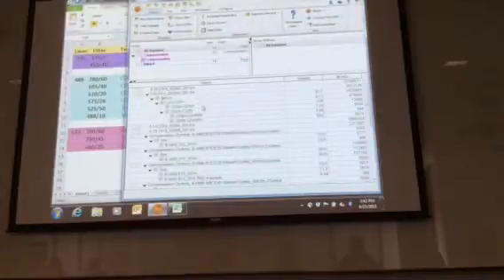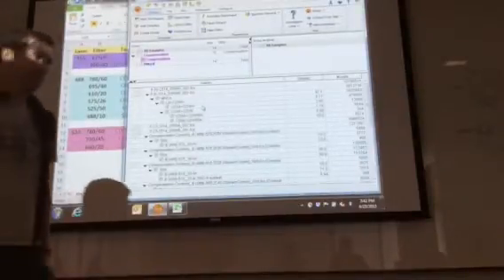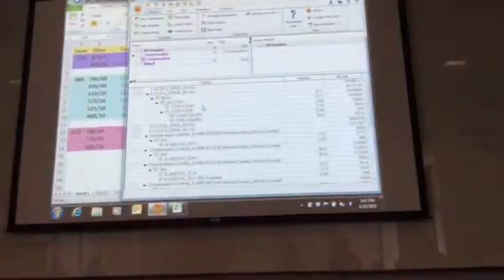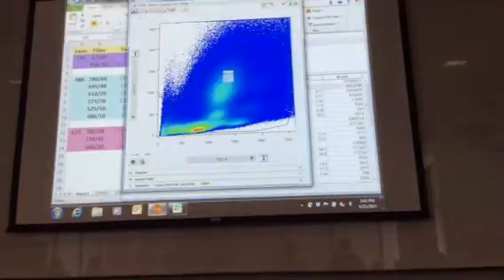And then what that will give you is a number of cells. I still don't get how to compensate, because when I check it, it looks like this, which is bad, right? No, that's fine. Yeah, that's just due to the number of cells. So that's not curving? No. If it goes off at a 45-degree angle, it's bad. That's actually perfectly fine.